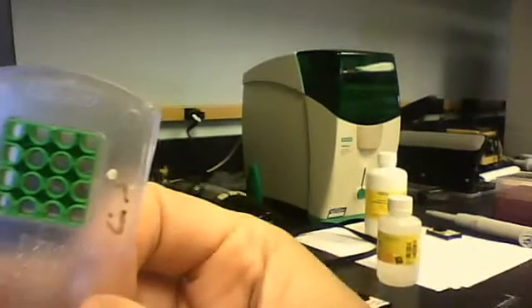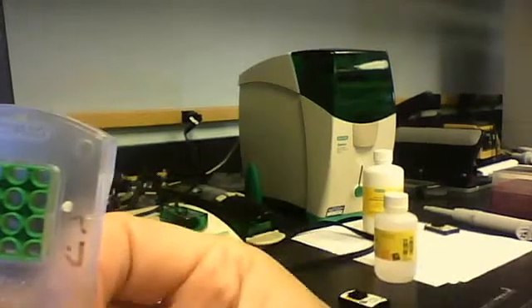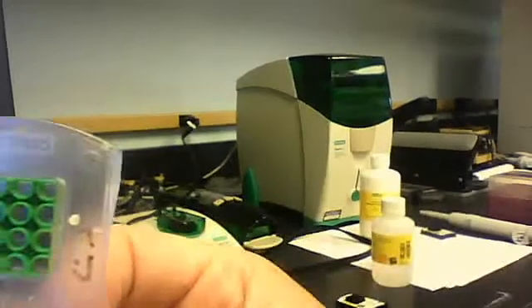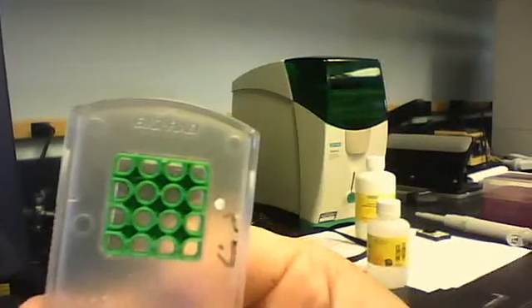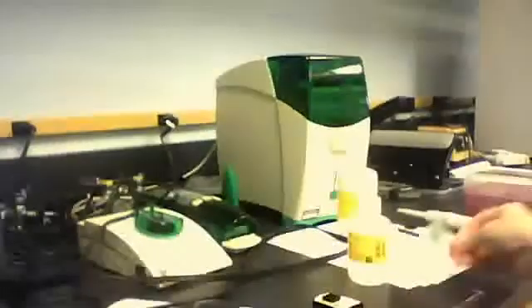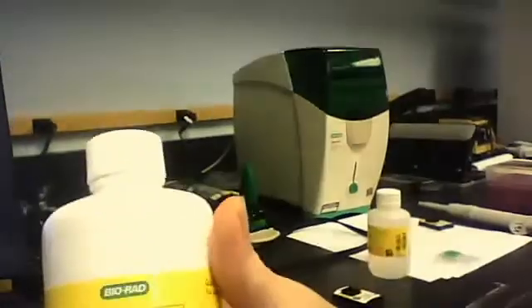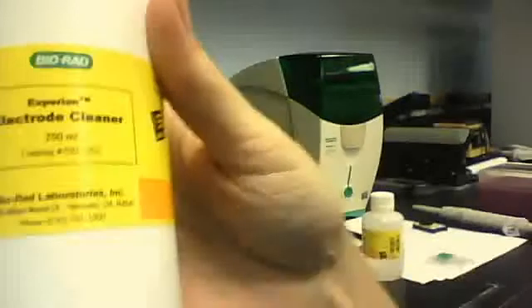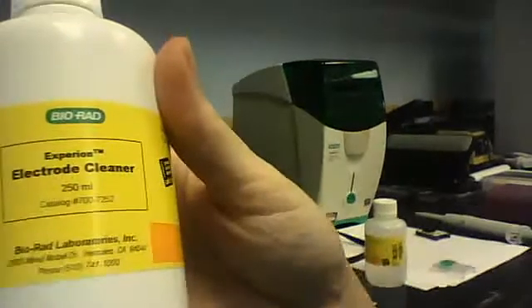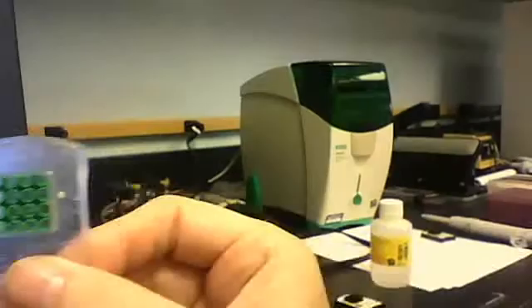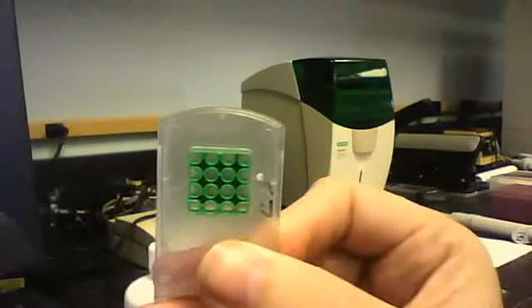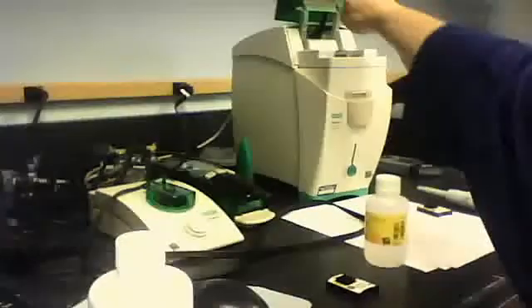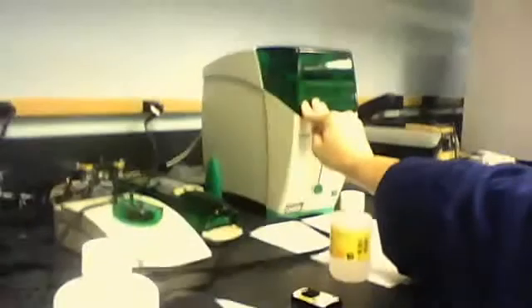It's a little bit different. The first thing you want to do, we're going over the Experion process. The first thing you want to do is clean your unit. You're going to need this, which is the electrode cleaner. And you want to pipette 800 microliters into one of these green chips. And then you want to place it into your unit. And you want to leave that in there for two minutes.